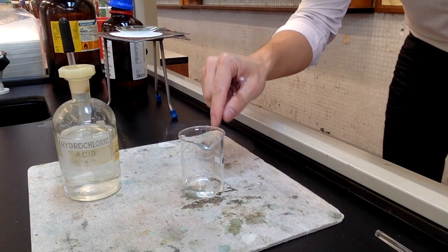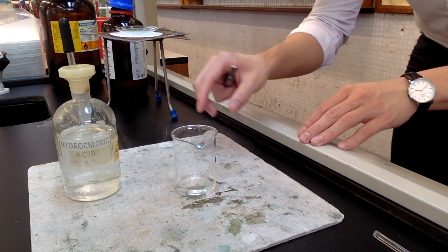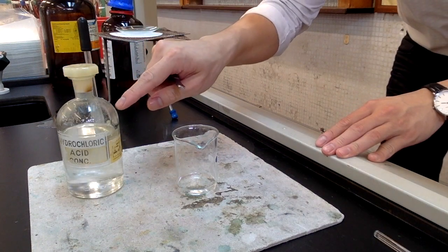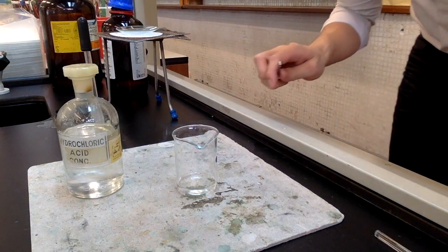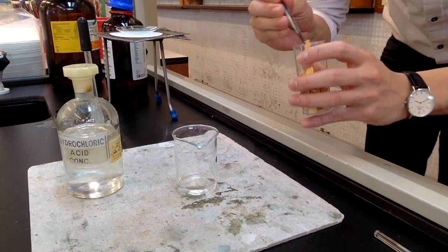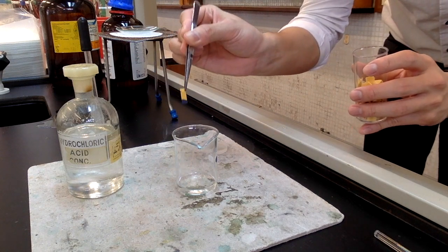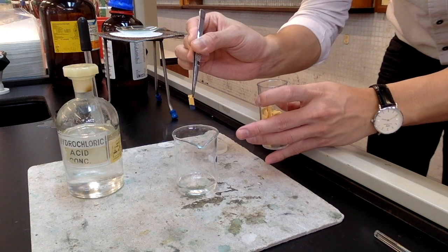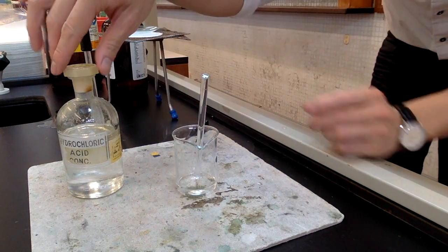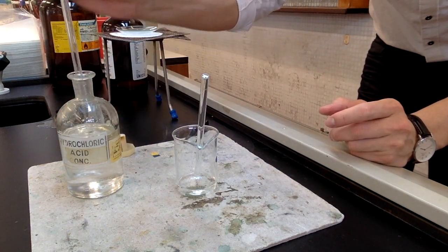So after transferring the mixture from the round bottom flask to the beaker, now we need to take the beaker to the fume cupboard, and there we are going to add concentrated hydrochloric acid. Now before we add the acid, if you add a pH paper, you will get a blue color because this is highly alkaline. With the stirring of a glass rod, carefully and slowly add in the hydrochloric acid.